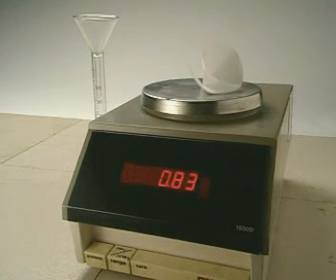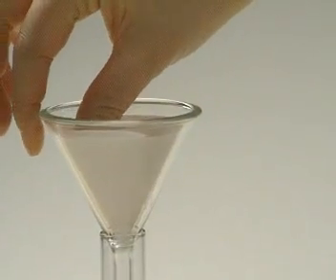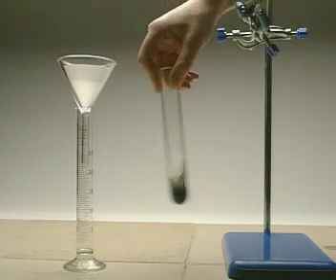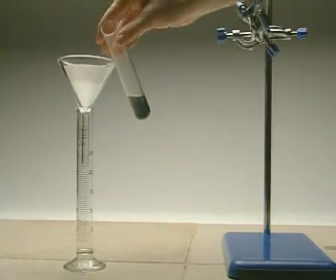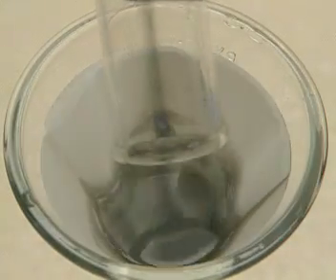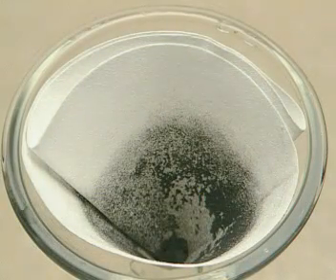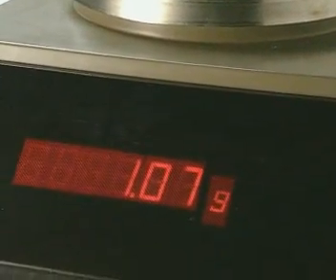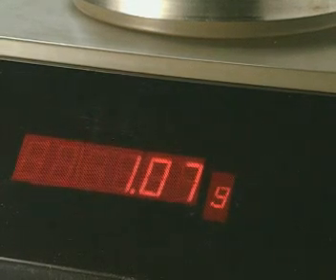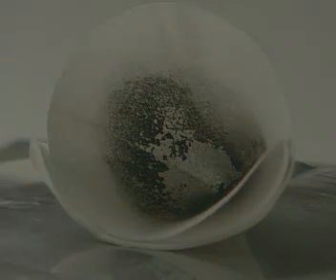Filtration will recover the catalyst from the other tube. The mass of this filter paper is 0.83 grams. Water dissolves away any remaining potassium chlorate, but the black catalyst doesn't dissolve. Once the filter paper has dried, it's re-weighed. Its mass is now 1.07 grams. If the filter paper alone has a mass of 0.83 grams, how much of the catalyst has been recovered? 0.24 grams.